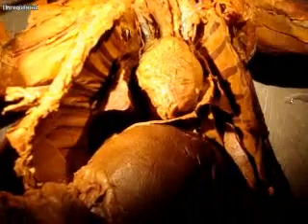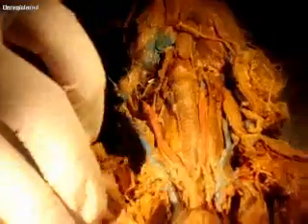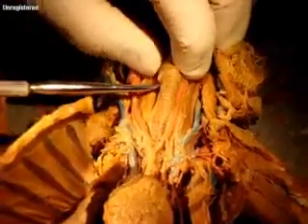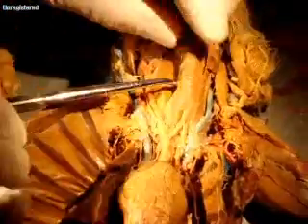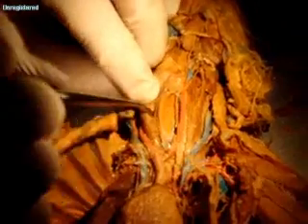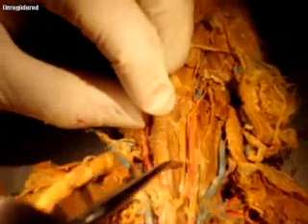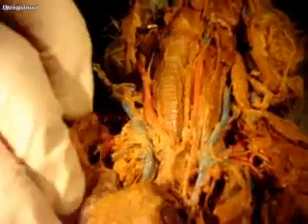I think that's it up here. Trachea, you all know that. You all know the larynx. Right here is where you should have your thyroid gland, which looks like part of it's gone — there's just a little bit left right there. The esophagus is actually right behind the trachea. If you roll your trachea to one side, there's the esophagus — it's a collapsed tube. This is that C-ring cartilage right here. And in terms of the heart, these dark things are the atria.